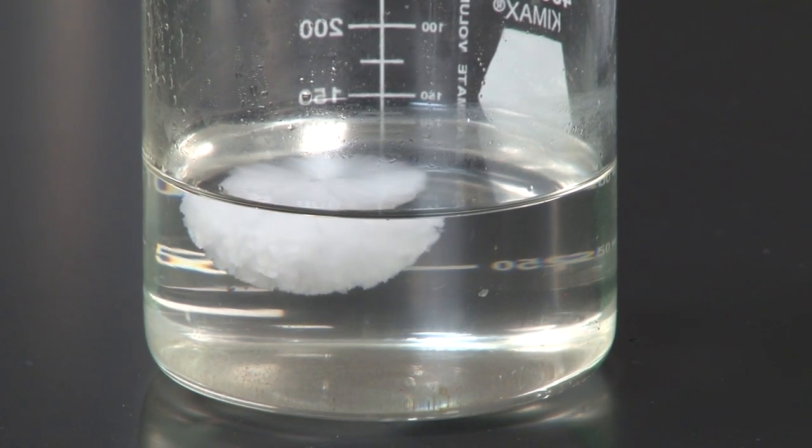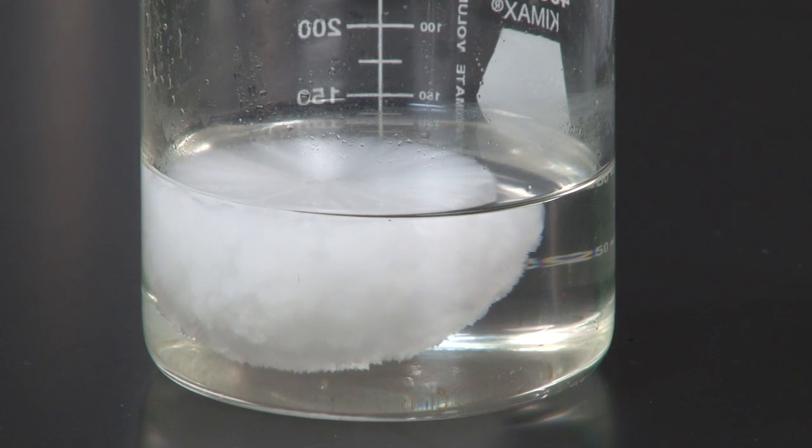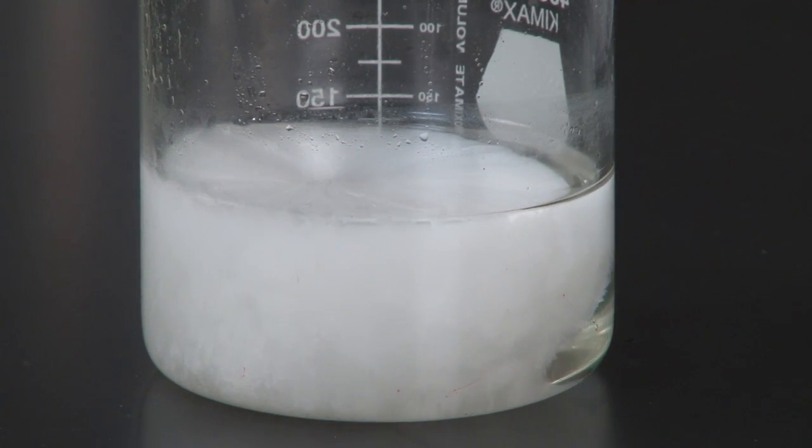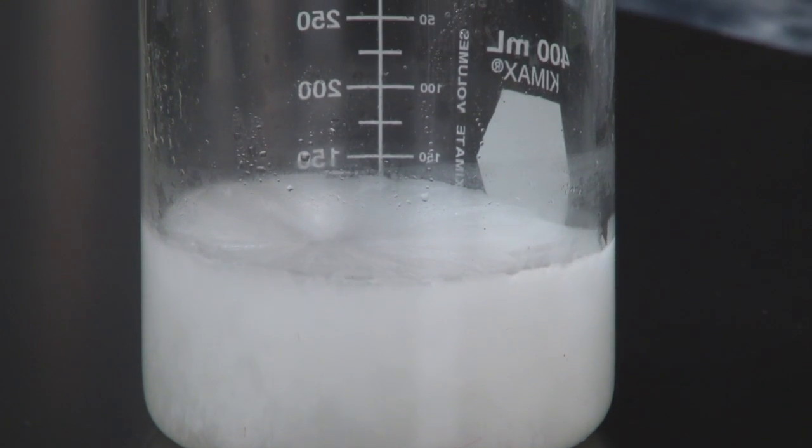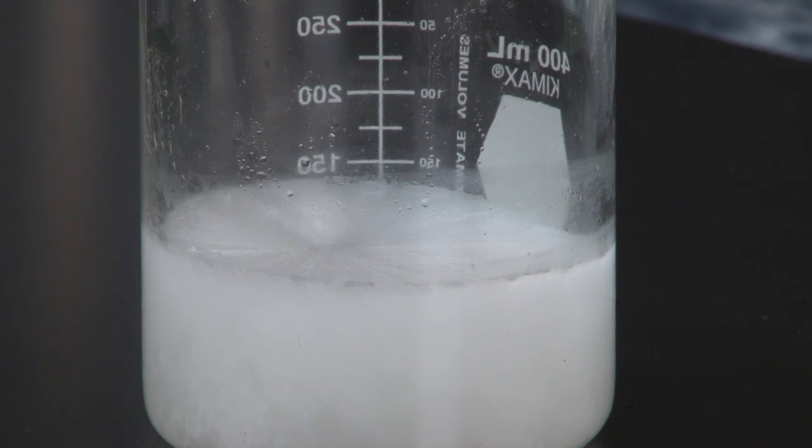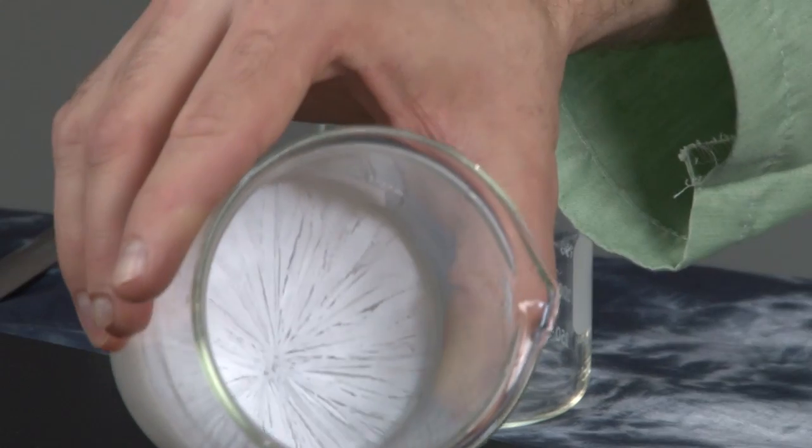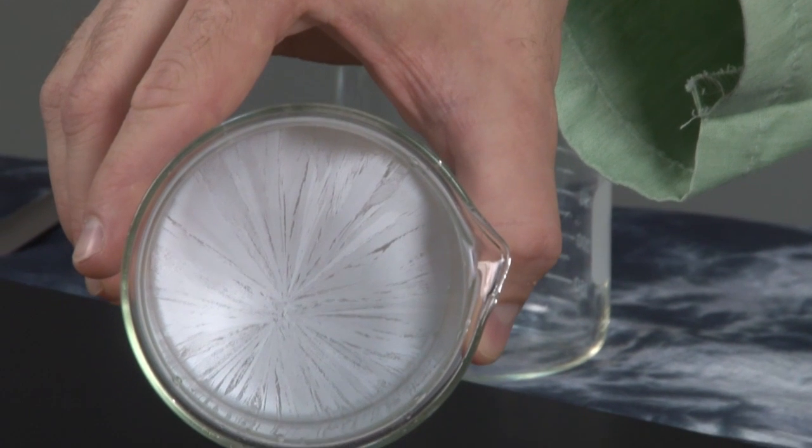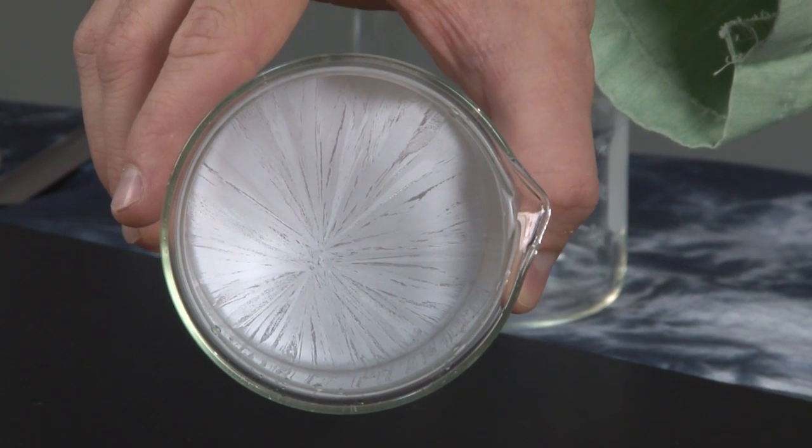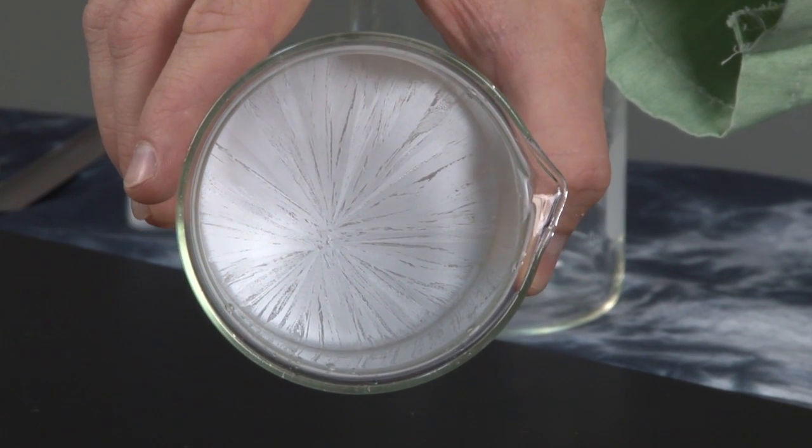Here we go. Pretty awesome. That was pretty fast. If we look in here, we can see that all the crystals are emanating from a central point. That's exactly where I dropped the seed crystal in.